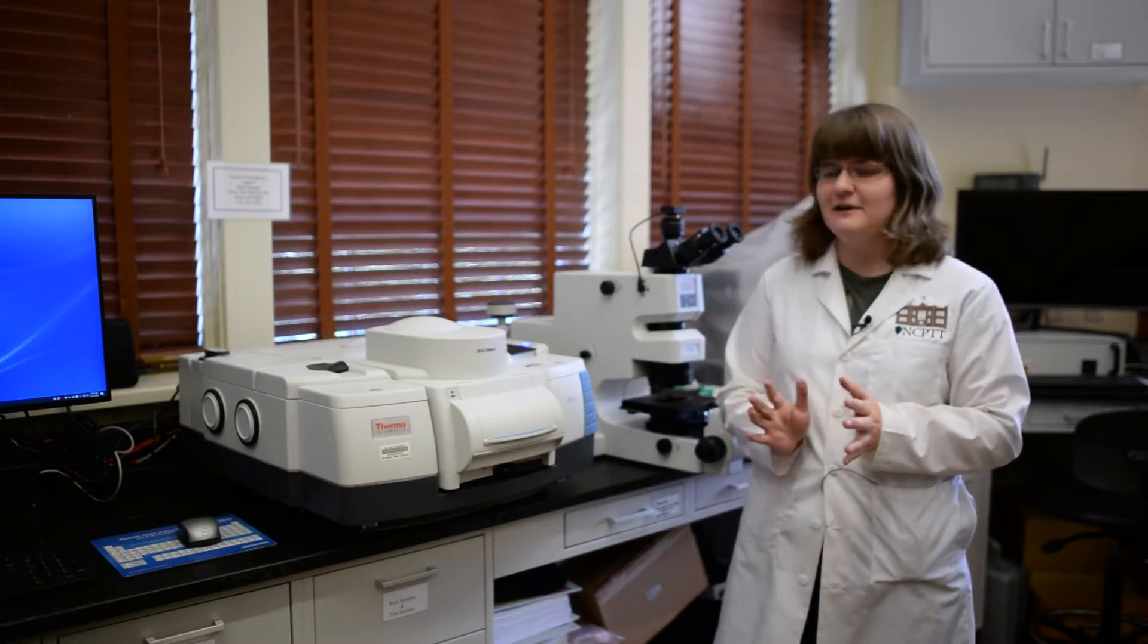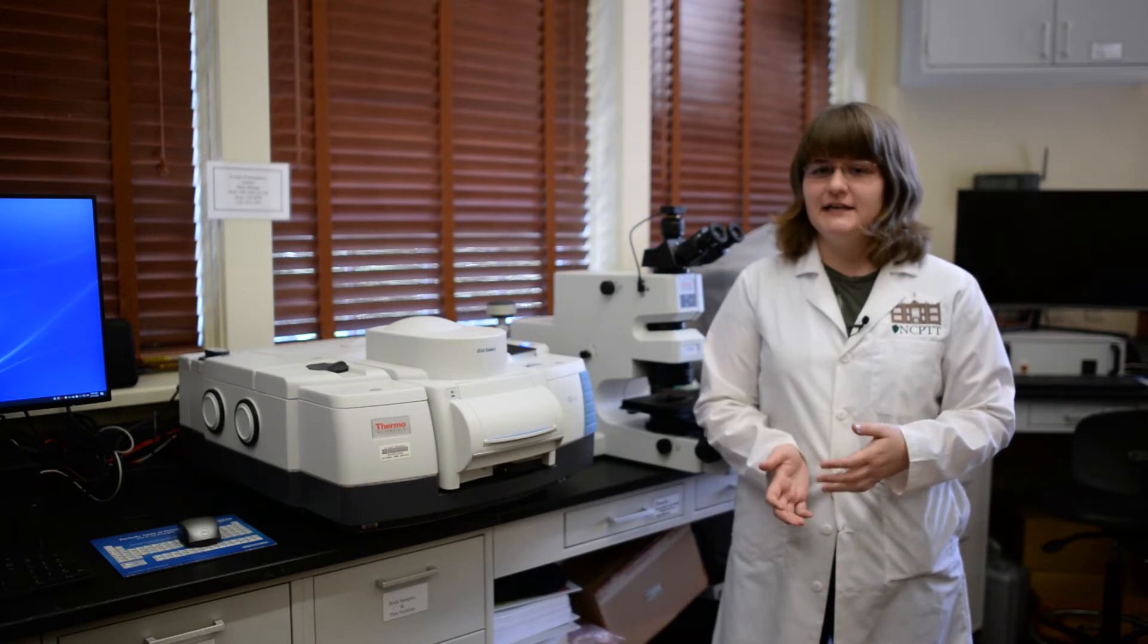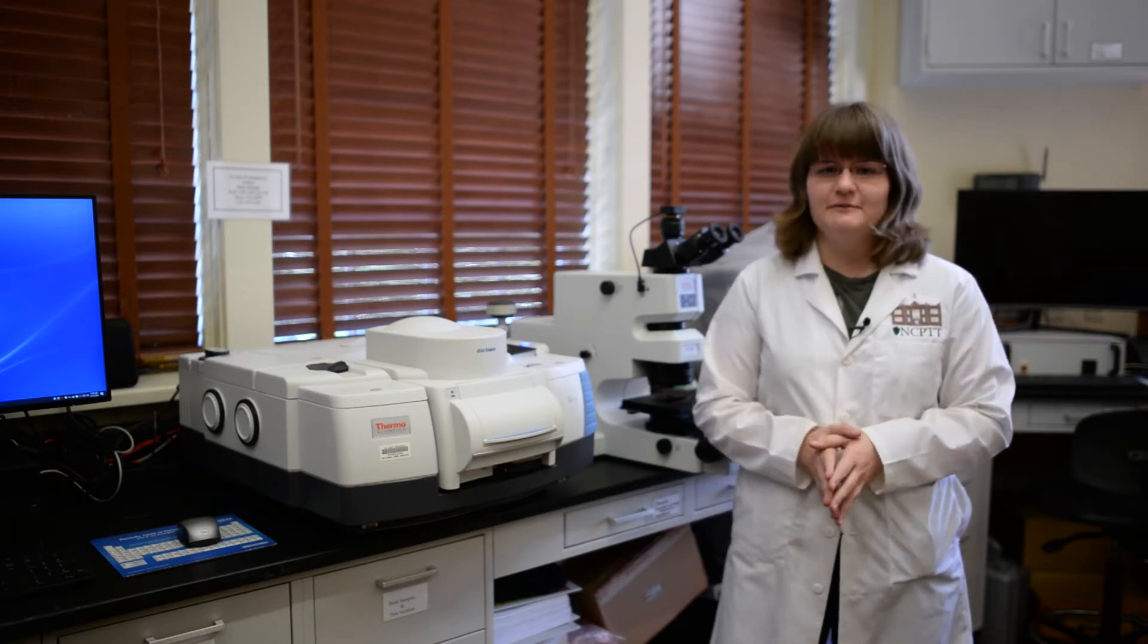We can use this instrument for a lot of different techniques in our lab. We can look for identifying unknown compounds or materials as well as surface contaminants, or we can look for how deeply these chemicals penetrate into the substrate itself.